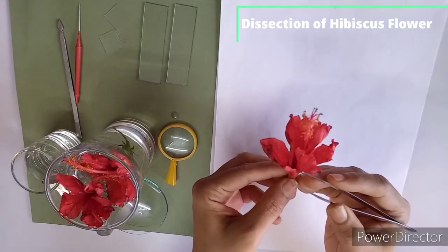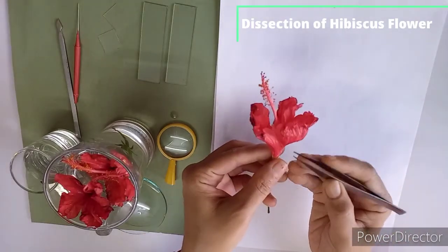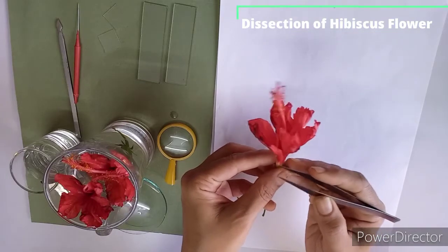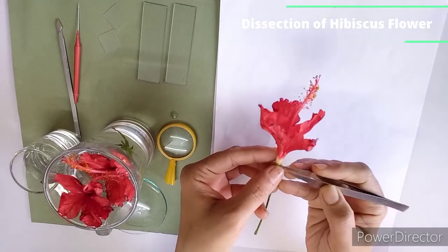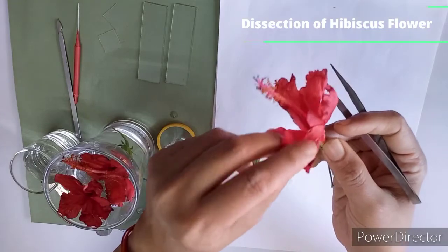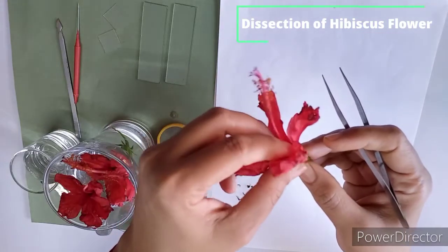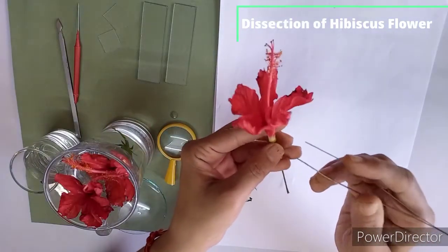So we can say it is polypetalous, red color, showy flower, and here you can see in this corolla twisted estivation is seen as these 5 petals remain free, but they create an overlapping arrangement at the margin of the appendages. So here you can see this is the margin, and at the margin of the appendages you can see this twisted estivation. Yes, as all these petals are arranged in overlapping manner. So their estivation is twisted.